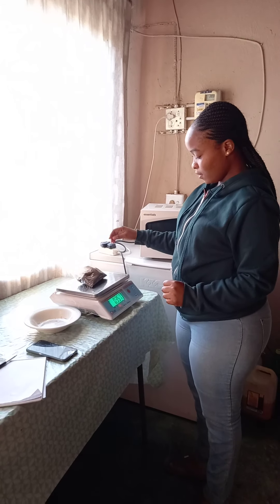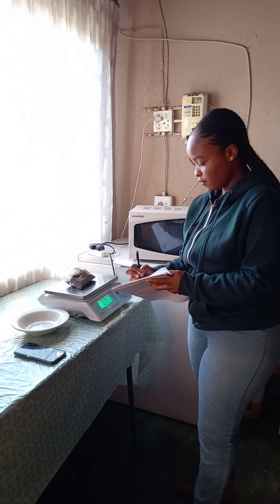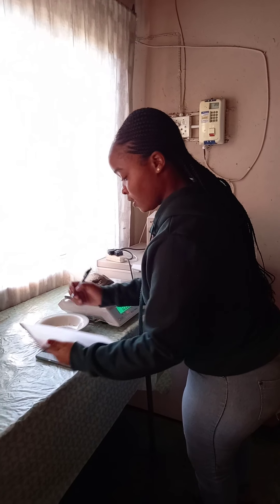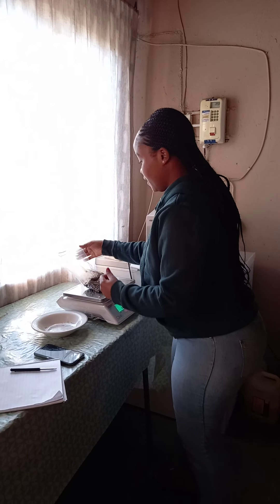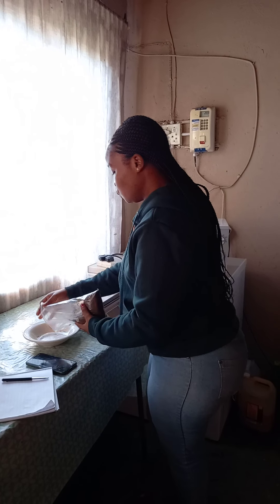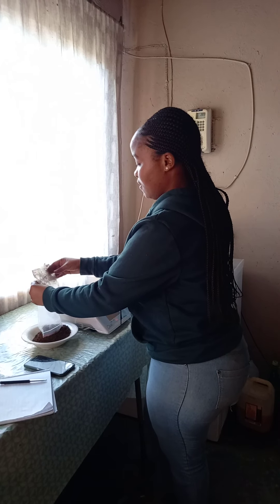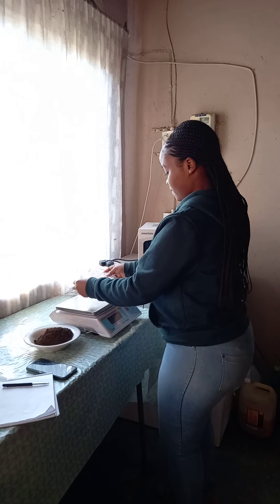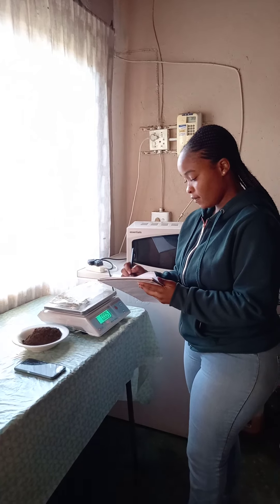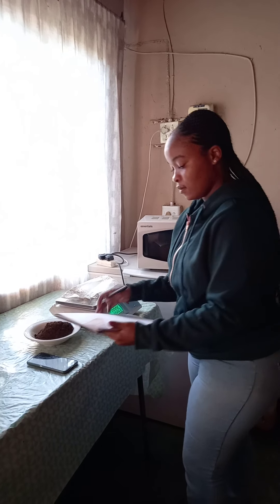My soil sample is 0.357 kilograms. We're going to multiply it by 1,000 so that we can get grams. And then we transfer our soil into the bowl so that we can weigh the plastic bag. My plastic bag is 0.005 kilograms, which we're going to multiply by 1,000 to get grams.